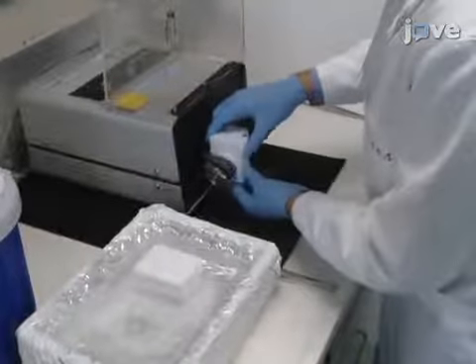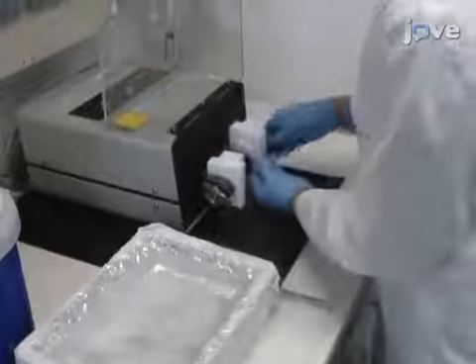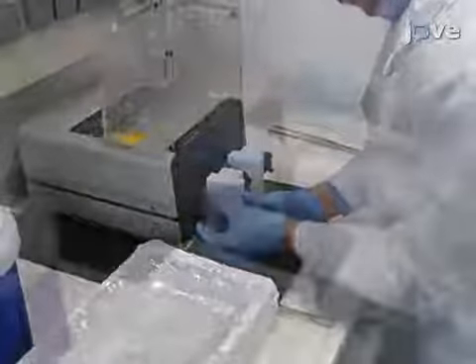Quickly put the tube holders in the tissue homogenizer and set the homogenizer to grind the biological material into a fine and homogeneous powder. For leaves, use 20 Hz for 1 minute.